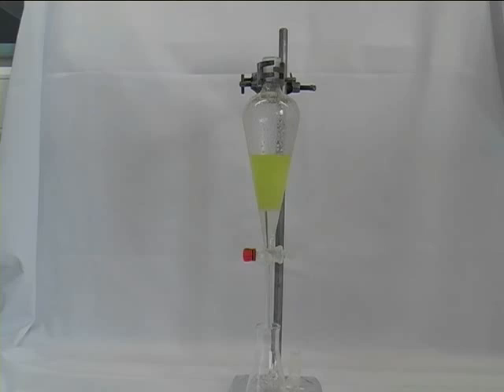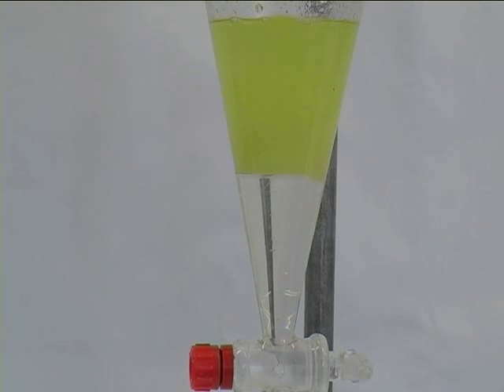The phase separation takes some time. You have to be patient until you cannot see any separation taking place anymore. This process will take a little bit depending on the nature of your solute and the solvents.